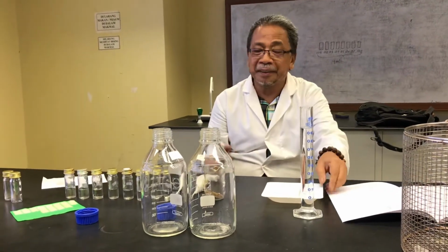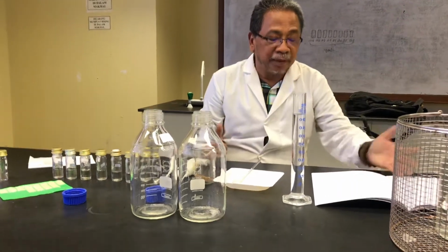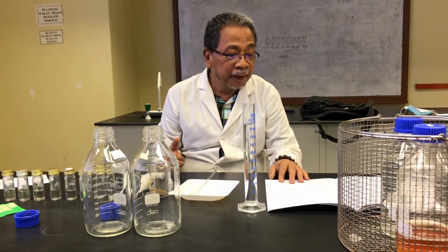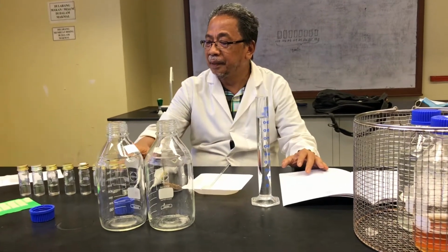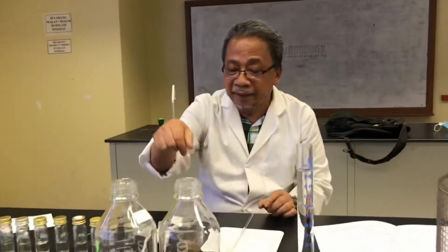This is where we are trying to explain the soil microbiology practical, on page 17. So the technique is a plate dilution technique. For example, we have prepared all the media, the TSA, the RBC, all these things. Now we want to do the dilution technique. You have to prepare dilution. You know why? If you take directly from the soil and you don't dilute, you cannot count the bacteria. It's too numerous to count.